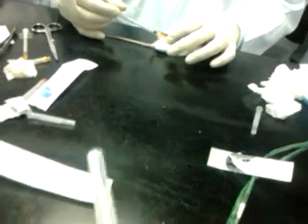The heart may be big, not easy to puncture well. Maybe it touched the wall. That's the blood.